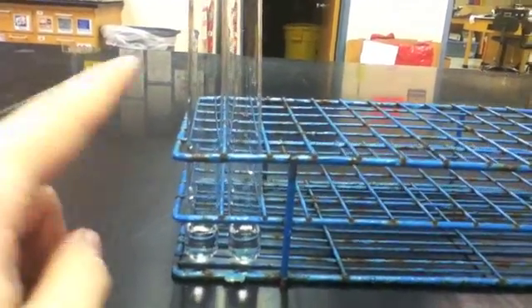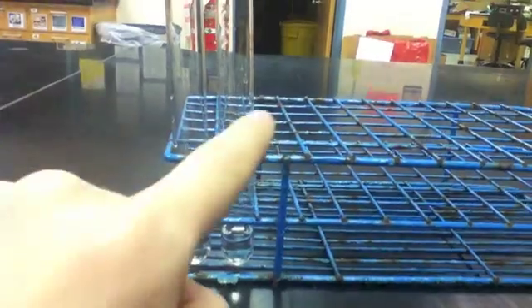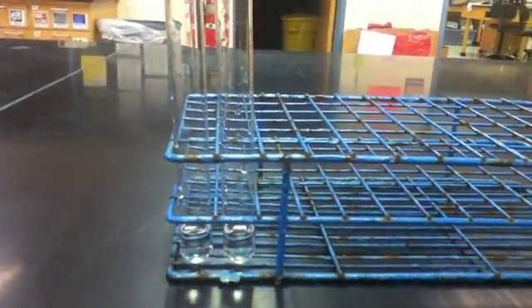I've placed two different solutions in these test tubes. Glucose is in the left and water is in the right. Glucose solution will act as the positive control while the water acts as the negative control.